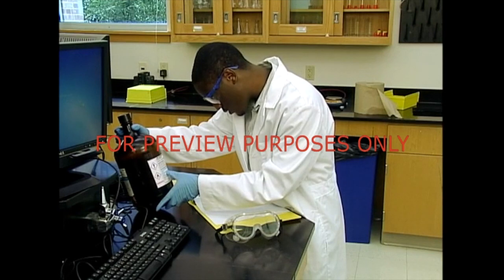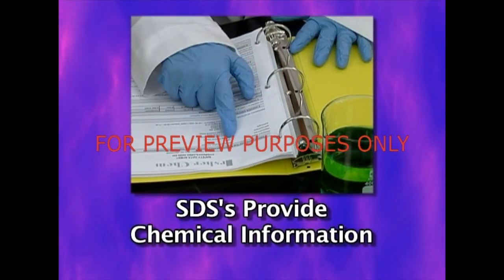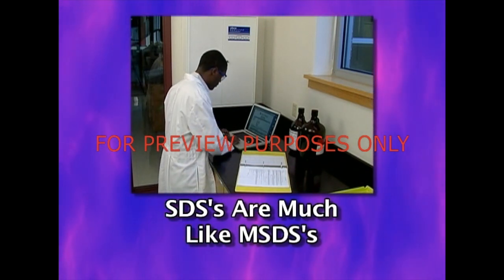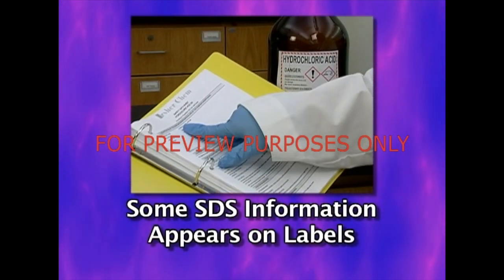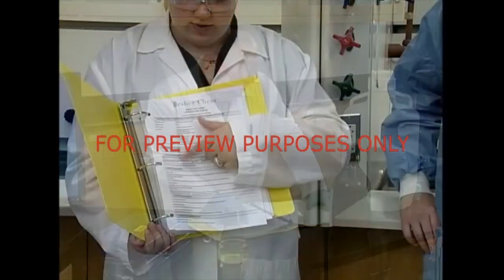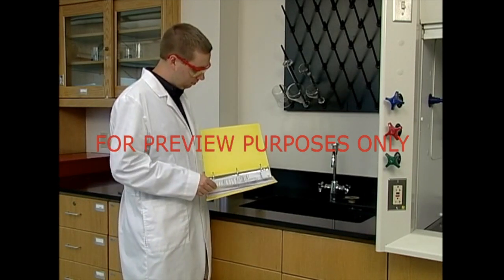There's a lot we need to know about the chemicals we work with, and safety data sheets are where to go to find it. GHS safety data sheets provide information about the chemicals you work with. SDSs are organized much like an ANSI MSDS and contain much of the same type of information, presented in an as-needed order. Some of the information from an SDS also appears on a chemical's container label. GHS safety data sheets are a valuable tool for working with hazardous chemicals, and understanding them will help you to do your job safely. So make sure you know where the SDSs are in your laboratory and read them before you use any chemicals that you work with.